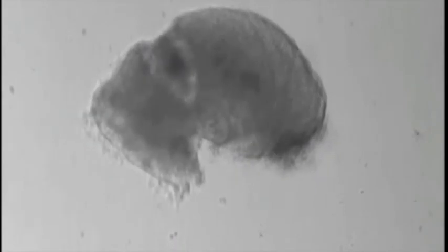Here is a time lapse of an explant put down on the gel. You can see the cells spreading on the surface and invading the collagen gel.